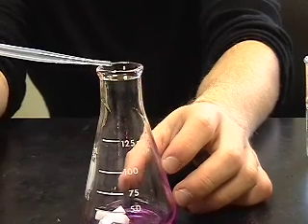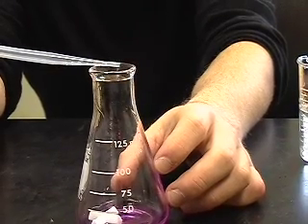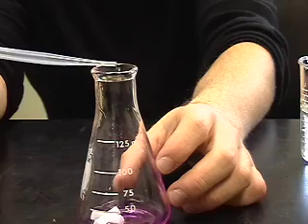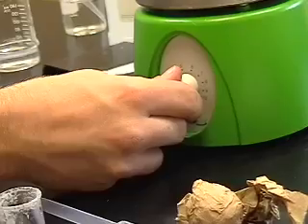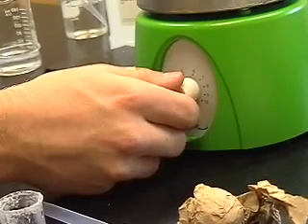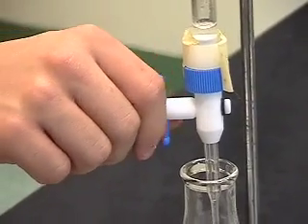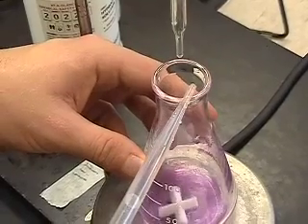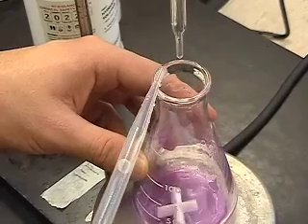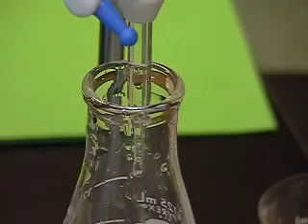Then, when you add HCl, you will know how many moles of HCl were added based on looking at the burette. In addition, the reaction occurs in the flask, which means both the HCl and NaOH will be equally exposed to the water. For this titration, like the last one, you turn on your spinner and start the flow of acid into the flask from the burette. After a while, you add some more water to the sides of the flask so that none of the HCl or NaOH gets wasted and affects your results.